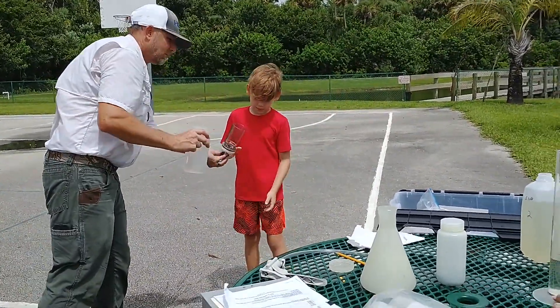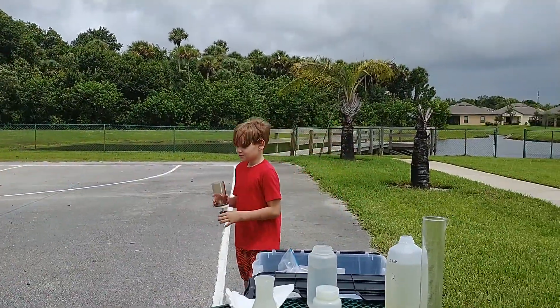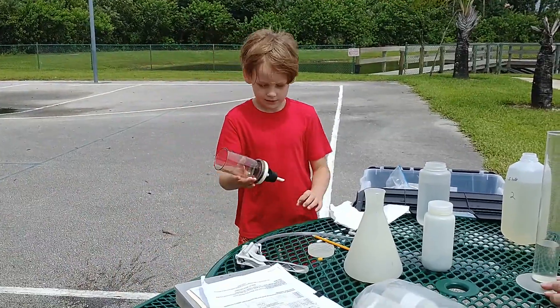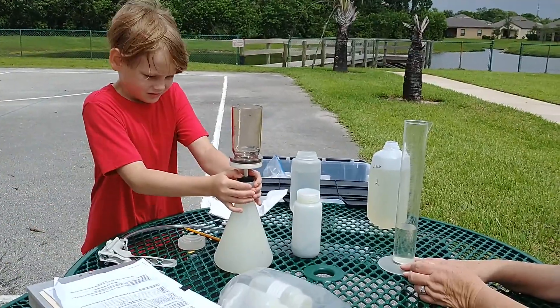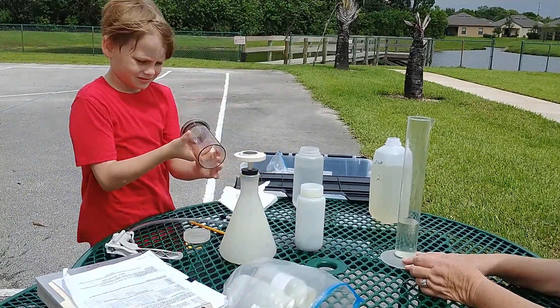That's flat on my feet — yep, that's what I was trying to show you. Now come over here. Stick it right in there and smush it down with the stopper. Then use the stopper to push it down. There you go. Set it down.